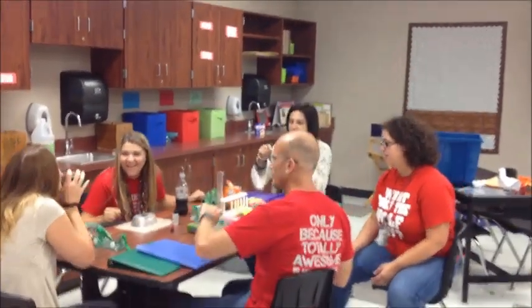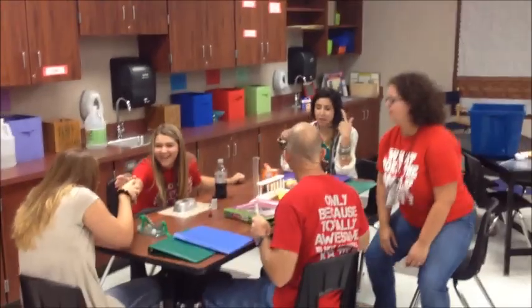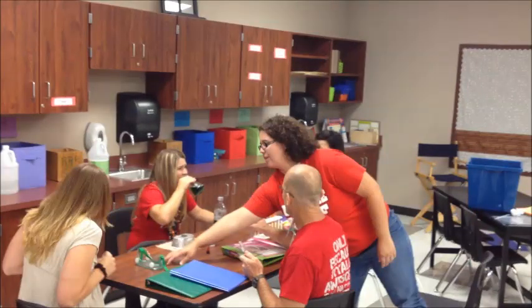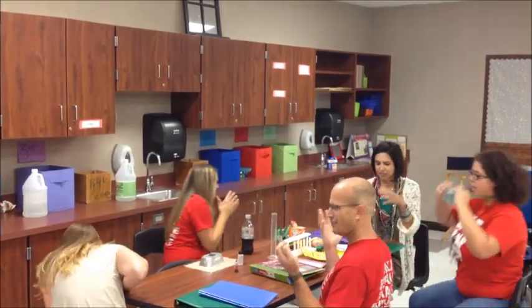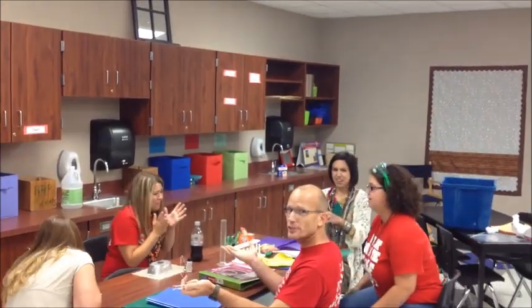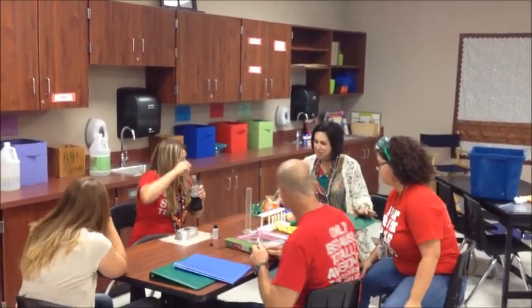Does anybody have a pencil? Balloons. I need a pencil. Oh, I got glasses on. I don't need goggles. Oh, I'm not messing with this up, so that's not happening. Ew. Yes, I'm wearing my goggles. See, I can't work with these people. Look, they're going to get me in trouble.